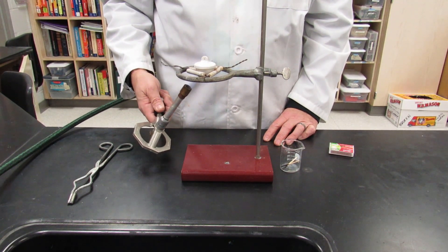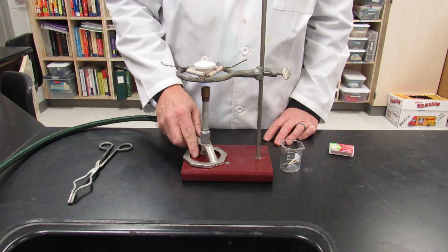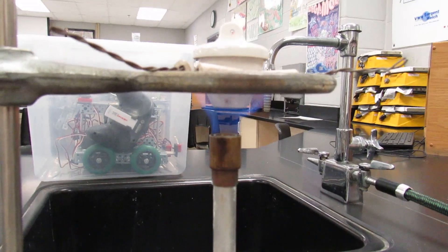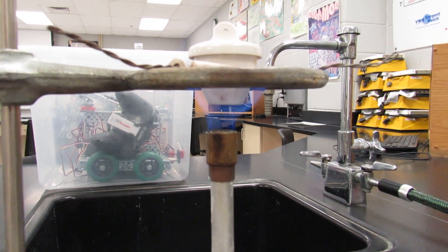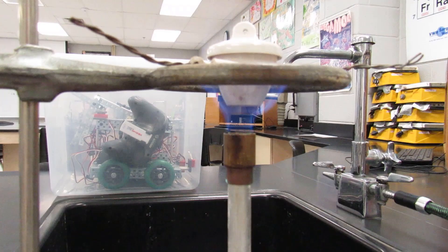After one or two minutes of driving off the water, you're going to put the crucible right up against it. And this is how close it should be. Make sure you're that close.